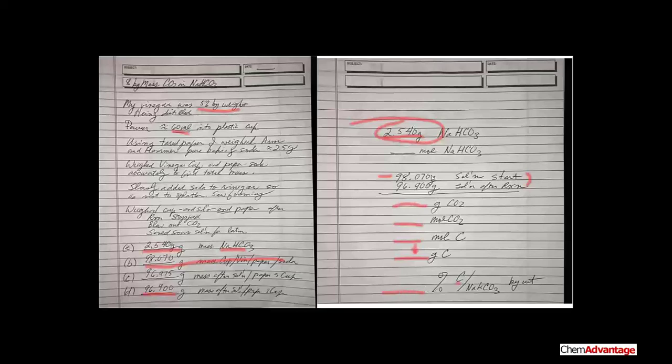Now I noticed in this experiment that as I was adding the baking soda, there's a little bit of splattering going on. You couldn't see it in the video, but I felt and smelt the vinegar as some of that stuff came out. So you'll be able to figure out the percent error on this as a result. So there's your calculation. Okay, very good.